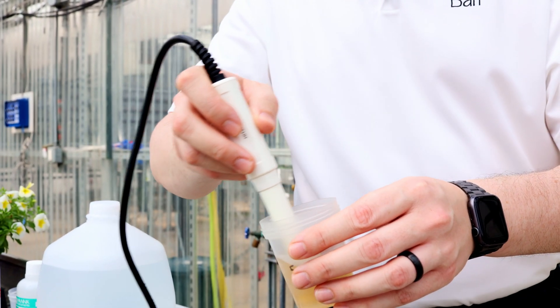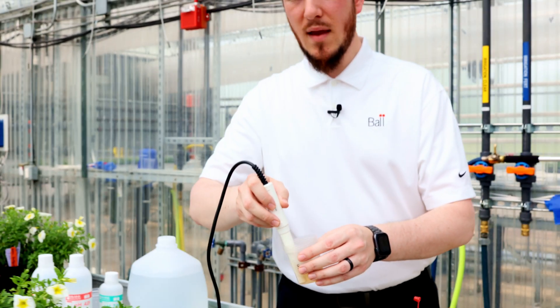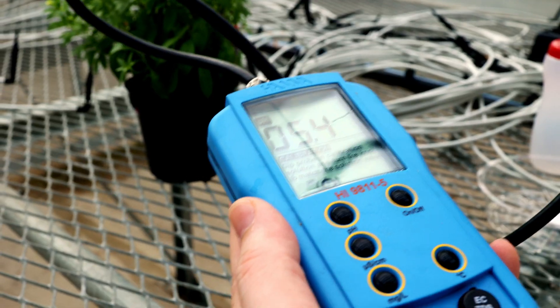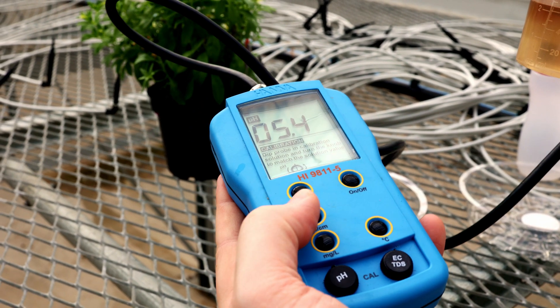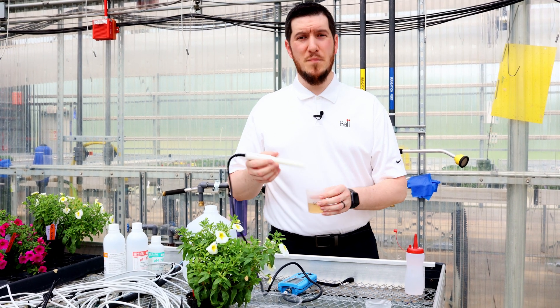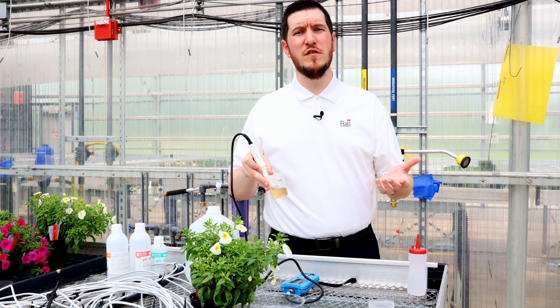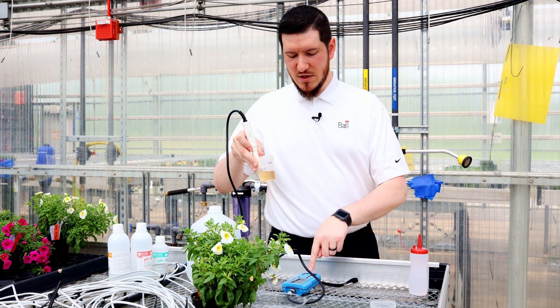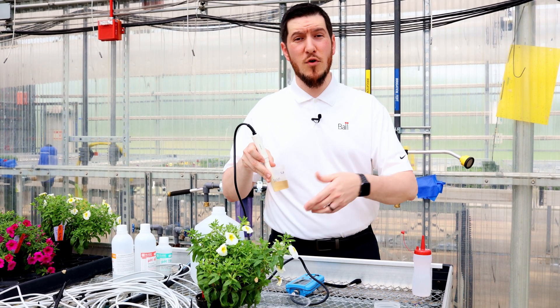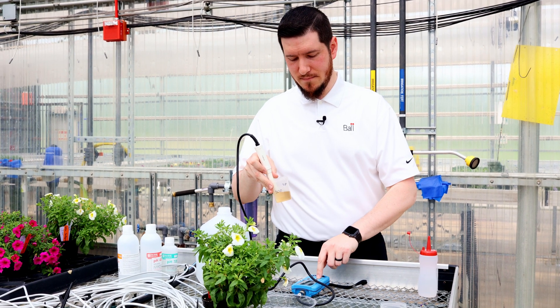Gently swirl the probe and wait for the reading to stabilize. Once your reading stabilizes, jot it down. If you're using single parameter meters for pH and EC, now is a good time to switch to your other meter. But if you're using a combo or multi-function meter, press the button that switches from one parameter to the other — whether you're starting on pH going to EC, or from EC going to pH. Similarly, wait for the reading to stabilize and jot down your second reading.